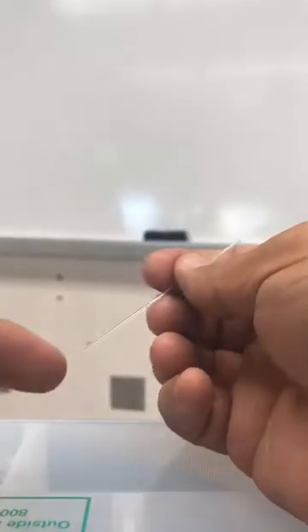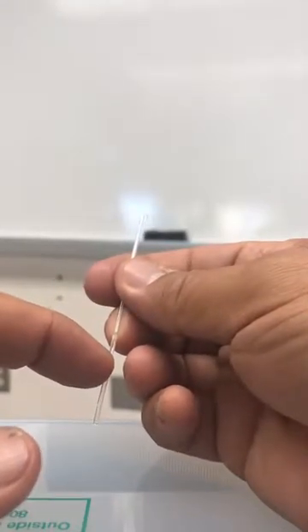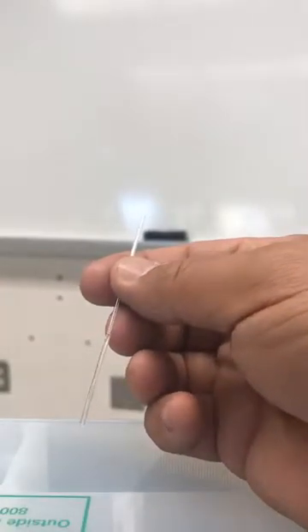Yeah, it's in there, but it's probably a little more organic material than I like. I'd usually keep it about here, but that's okay. I think it probably still works. So now we'll record the boiling point measurement.